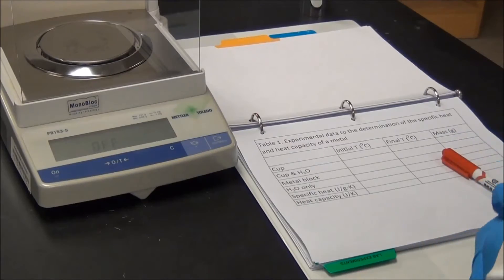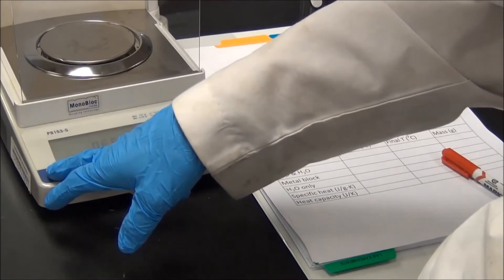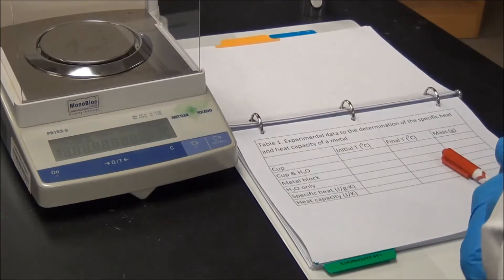But when we look at the balance, it seems the electronic balance is off. So make sure you press this button and then turn it on.